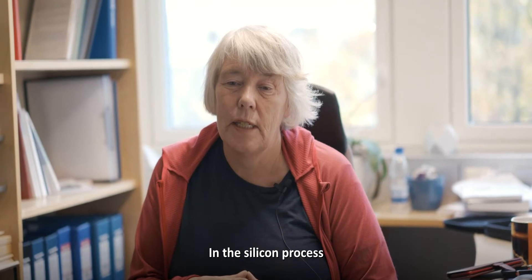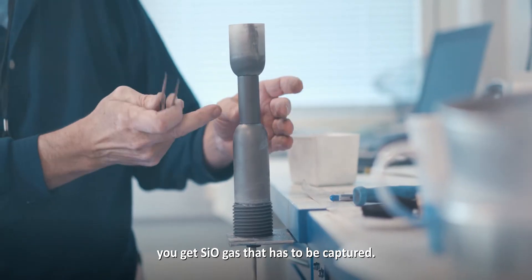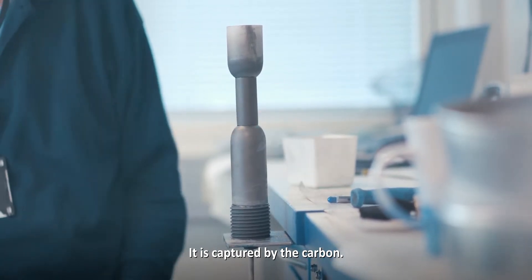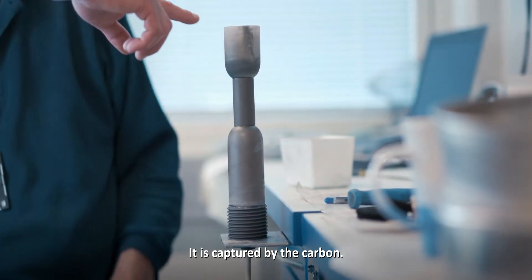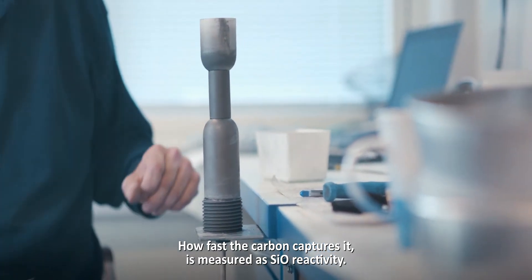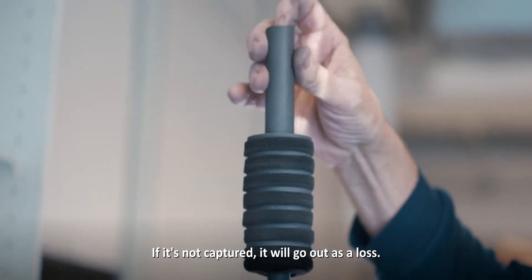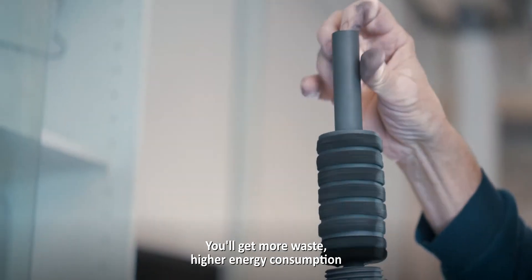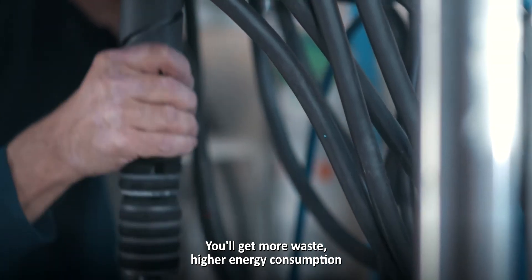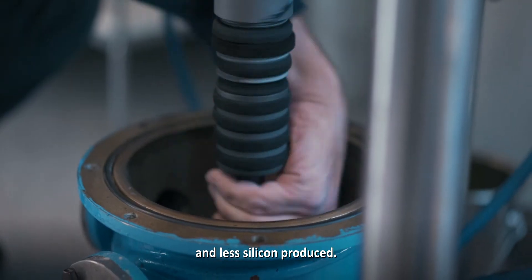In the silicon process, you get some SiO gas, and that has to be captured by the carbon. How fast the carbon captures it, we measure as the SiO reactivity. If it's not captured, it will go out as a loss — you will get more waste, higher energy consumption, and you will get less silicon produced.